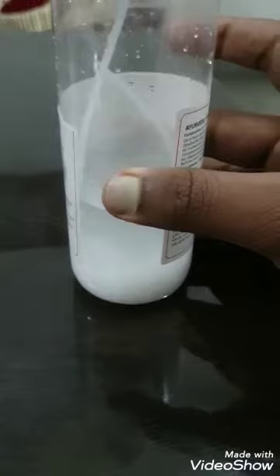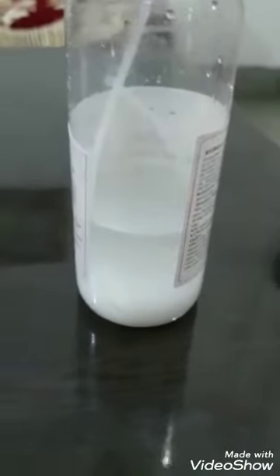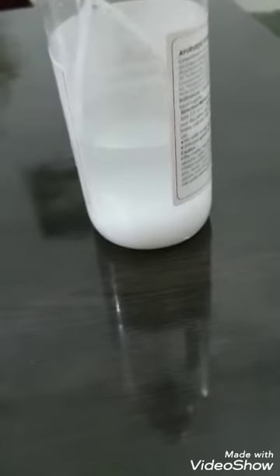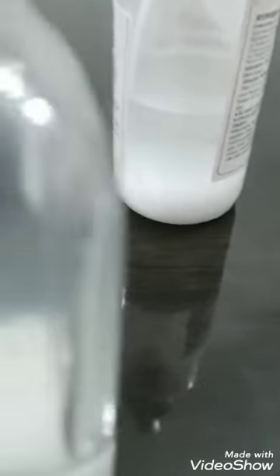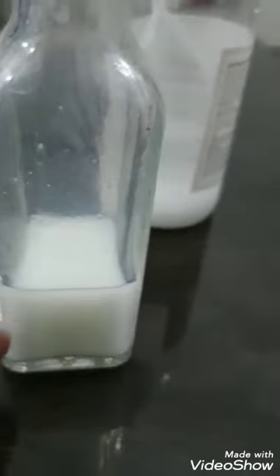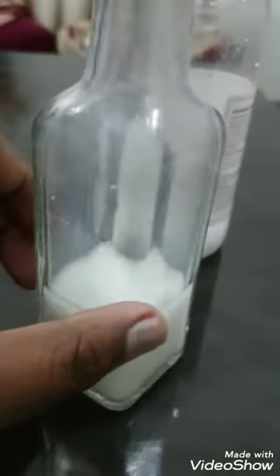Make sure that the water you're using is not too cold. Otherwise it's literally going to take you 12 hours to complete the reaction. I think there will be still some reactants reacting in this container.